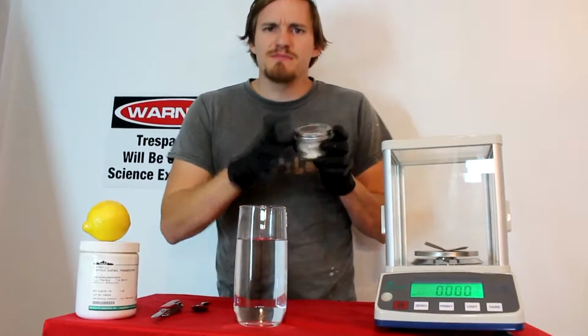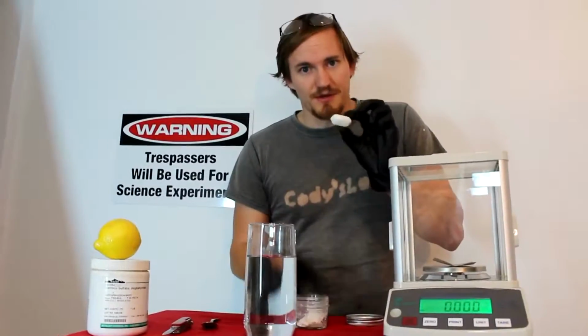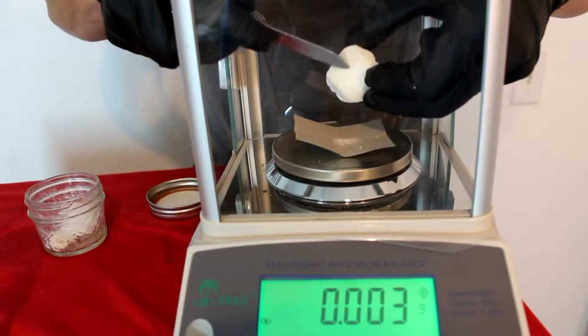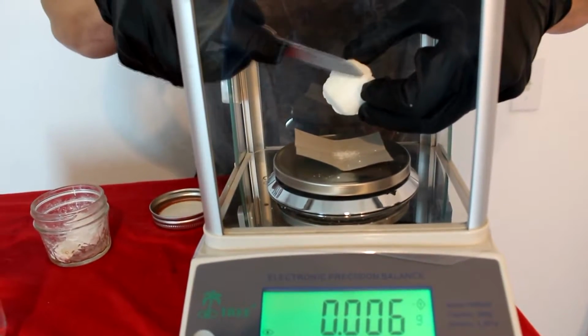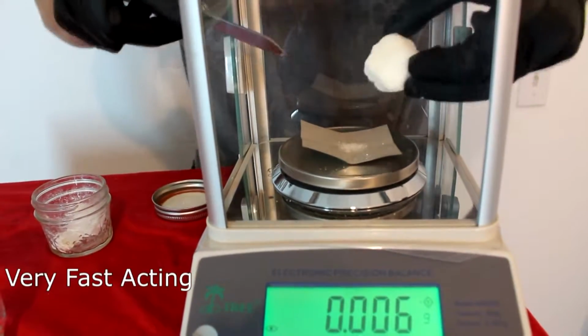So I have here some sodium cyanide, a very useful chemical in many processes such as mining. In fact, that's what these pellets were originally made for. If I bring this over to the scale, now I'm going to shave off a little bit of the substance that was also used by the Nazis during World War II to kill people in their concentration camps. Because cyanide is very cheap, but also a very effective poison.